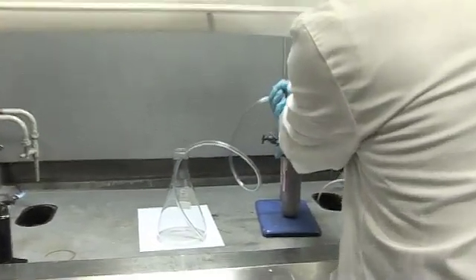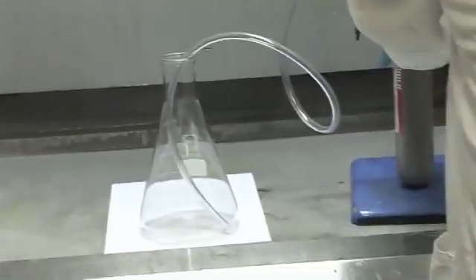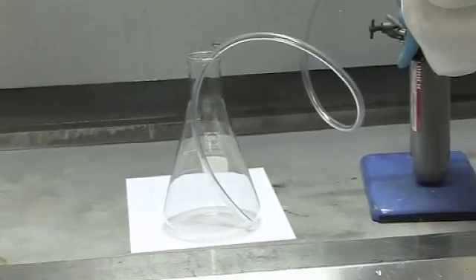Okay, so Neil is about to open the cylinder of chlorine to allow some chlorine gas to leak through the pipe into the flask in the fume hood.